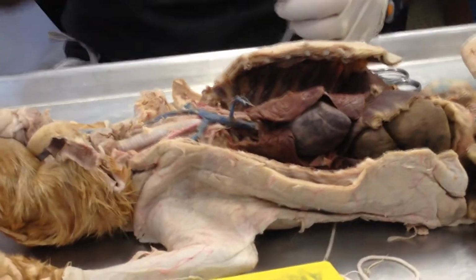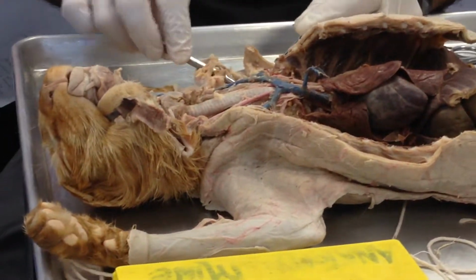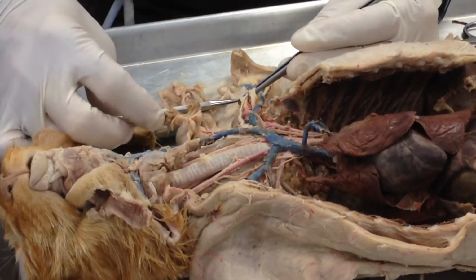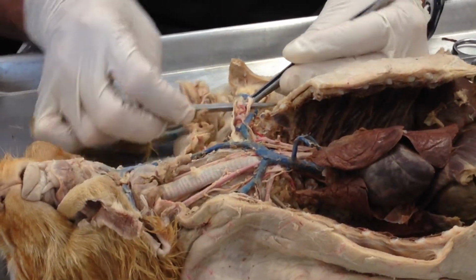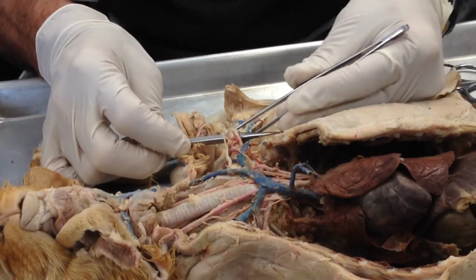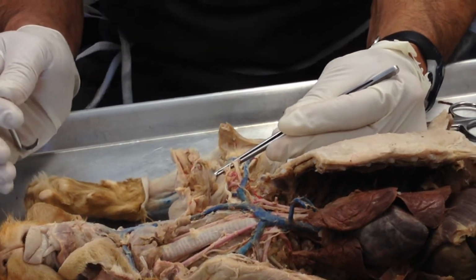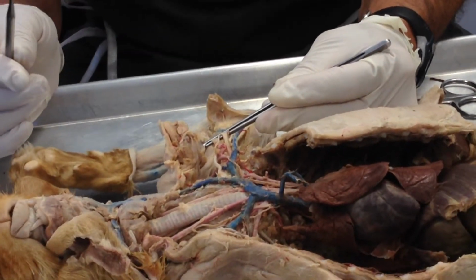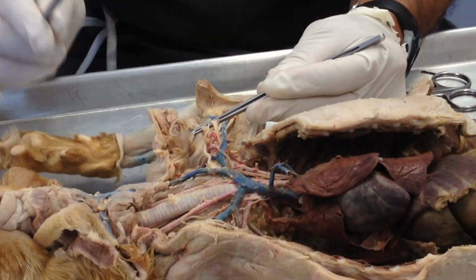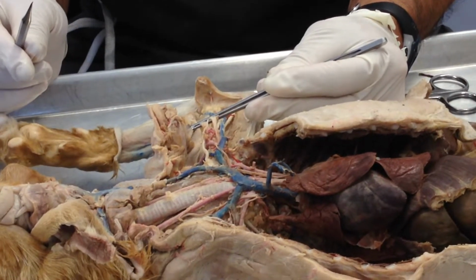So there was the vagus nerve and the branches of it. All of this right here is the brachial plexus that we talked about way back in bio 141. So all of that are the nerves of the brachial plexus. We are not going to separate out the musculocutaneous, the axillary, the ulnar, the median. We're also going to call that the brachial plexus. A huge bundle of nerves right there.